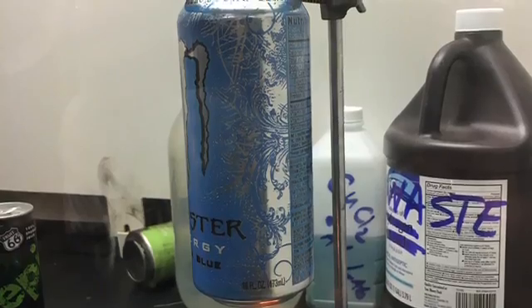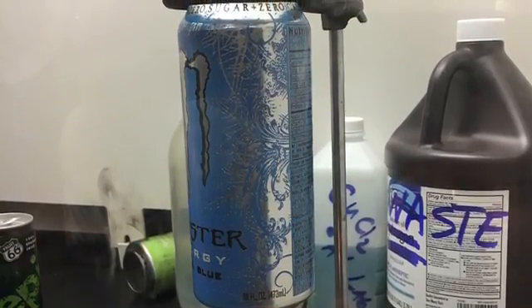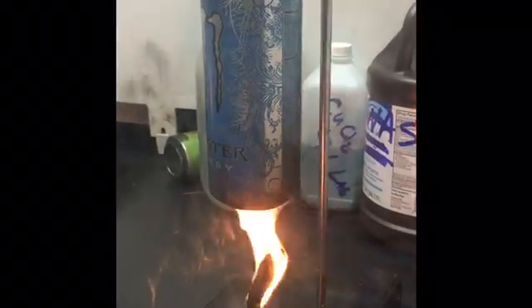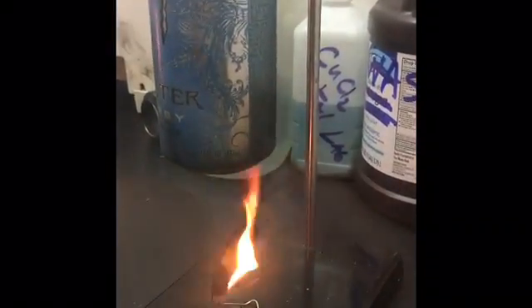We placed them in the indoor heater and lit the Cheeto on fire. It took the Cheeto two to three minutes to be charred and completely burnt. We then took it out of the heater and carefully measured its mass again.